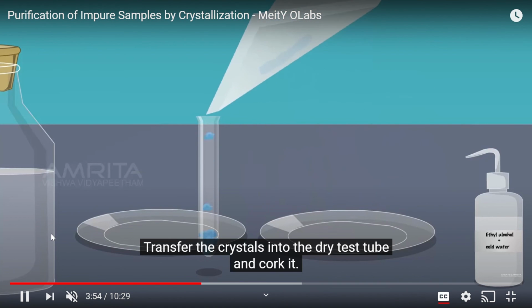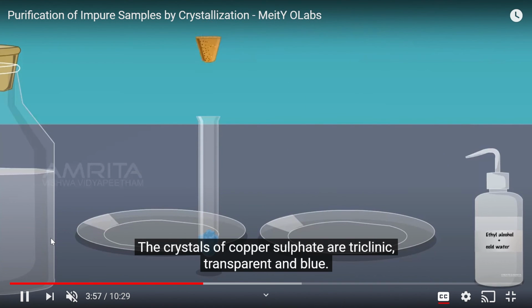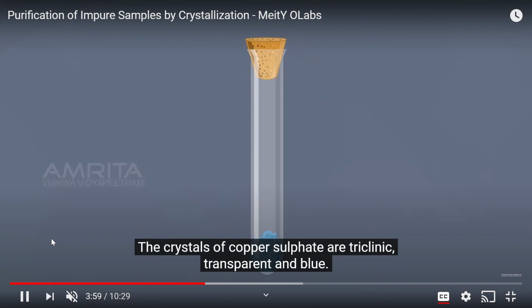Transfer the crystals into the dry test tube and cork it. The crystals of copper sulfate are triclinic, transparent and blue, as you see.